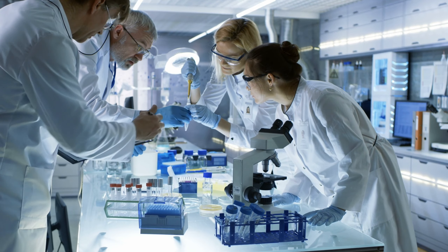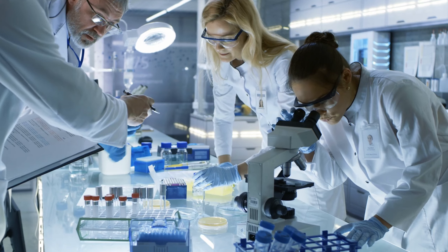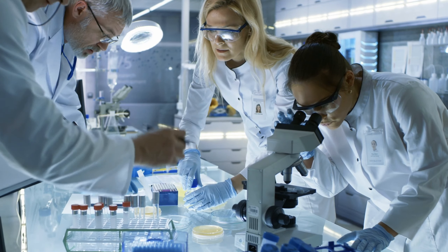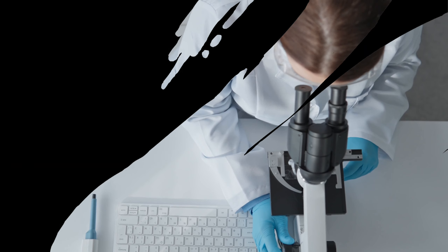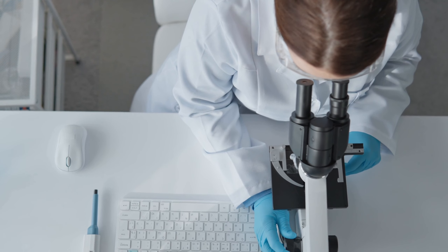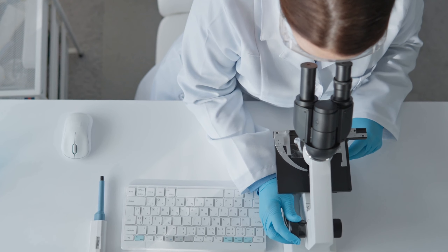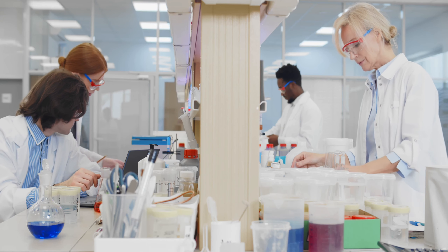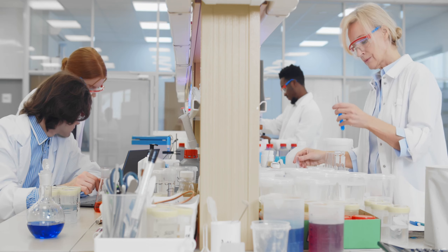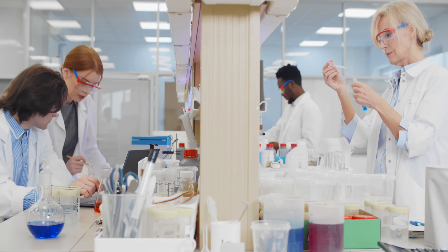The microscope has revolutionized the science industry and has had an enormous influence on the development of modern medical, forensics, and environmental science. It has allowed for enhanced accuracy and quality in scientific observations, leading to better results in research and diagnoses. Recent advancements in microscope technology are providing unprecedented views and information about biological structures and activity, opening up new avenues for disease therapies.